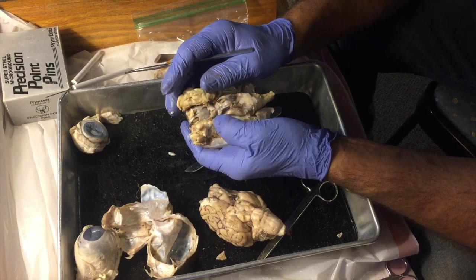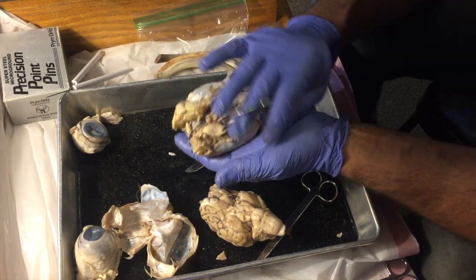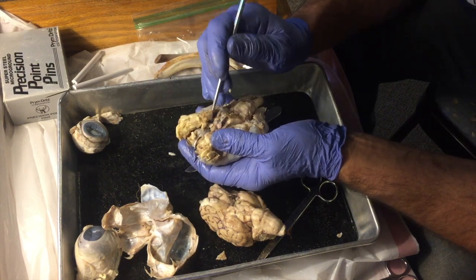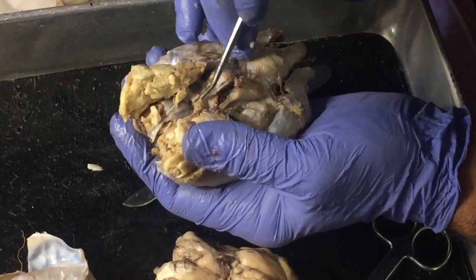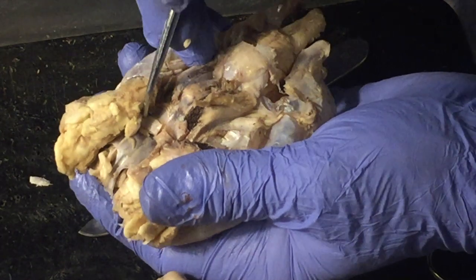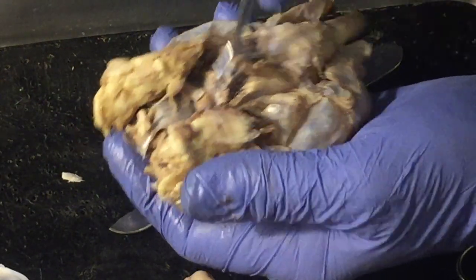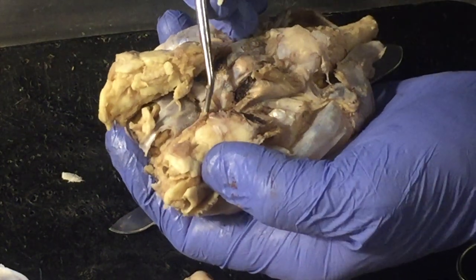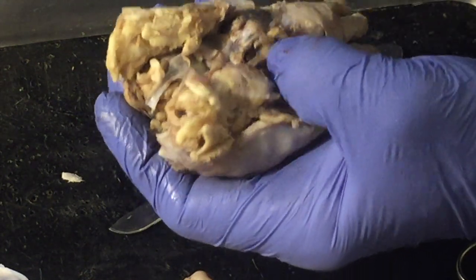Okay, so folks, I took the other sheep brain, and here's one eye, here's the other eye. I've turned it over, so this is the brain turned over. The reason I wanted to show you a particular structure, it actually got torn in the other one, so I wanted to show you here. Right here, I started to cut it. This portion coming out of this eye, and this portion coming out of this eye right here, are the optic nerves. And they form the optic chiasma right here.